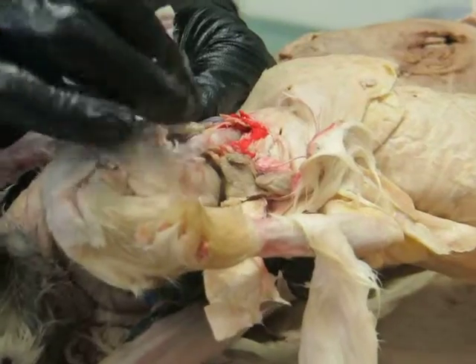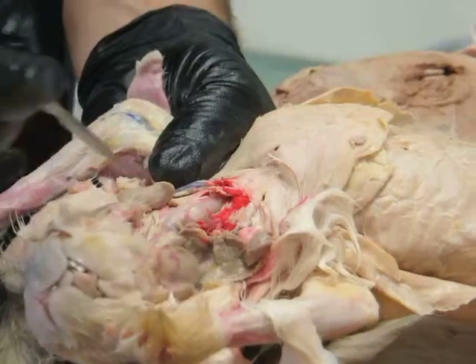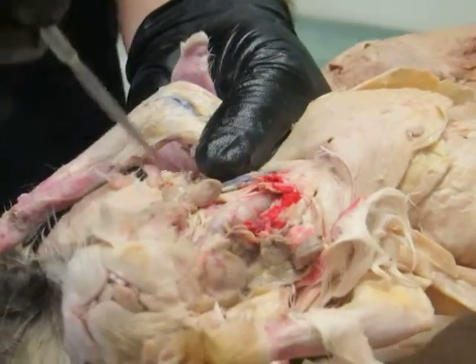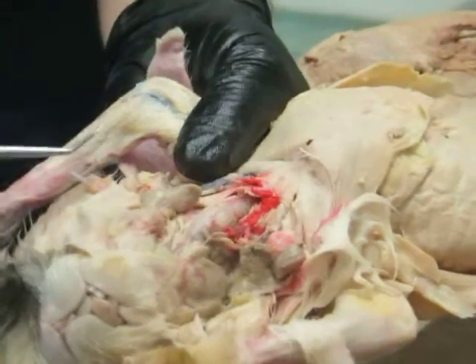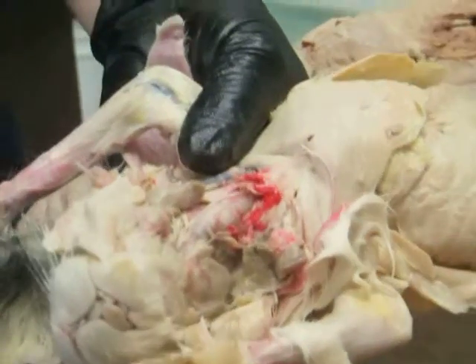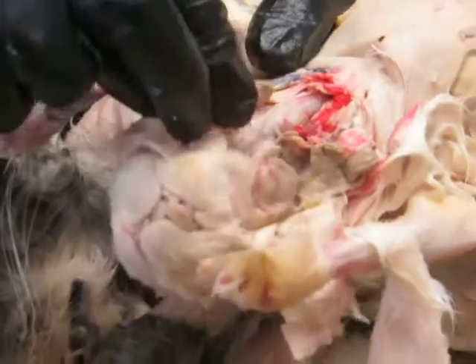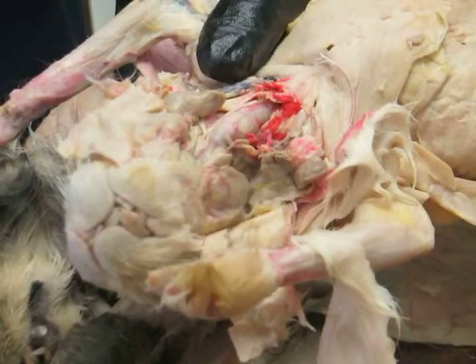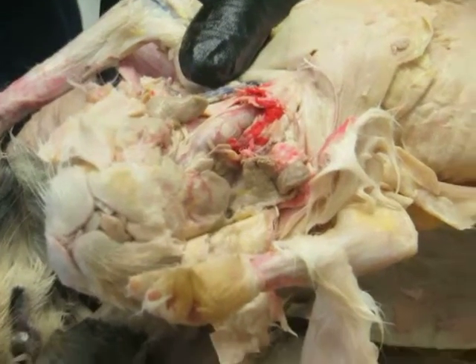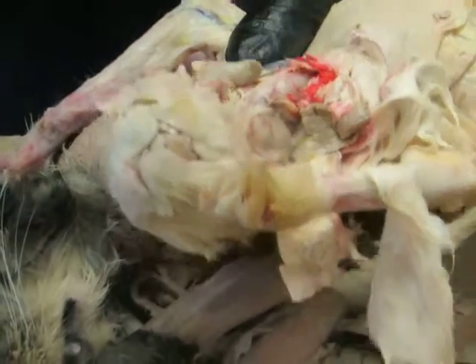Okay, let's put this back. If we look down here then, in the throat region, you see these two big bulging things here. Those are the jaw muscles. In particular, that's the masseter muscle, which is the main muscle that closes the jaws, particularly well developed in herbivores. So like this rabbit, big jaw muscle on the cheek. And it's coming off the zygomatic arch, originating there, and inserting down into the mandible, near the angle of the mandible. Chomp, chomp. Okay, so those are these guys.